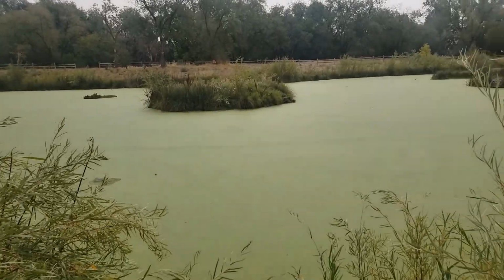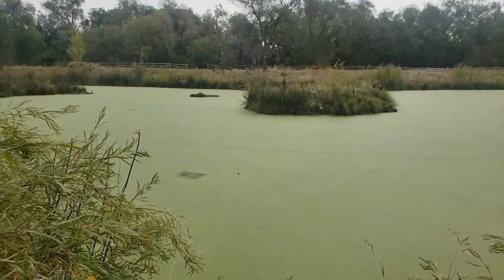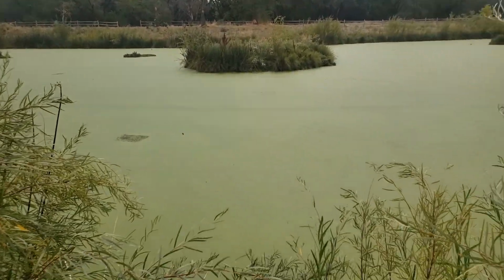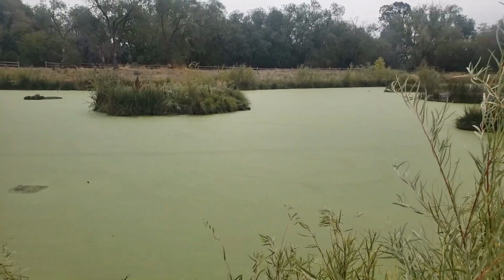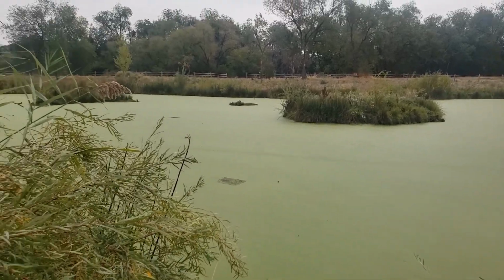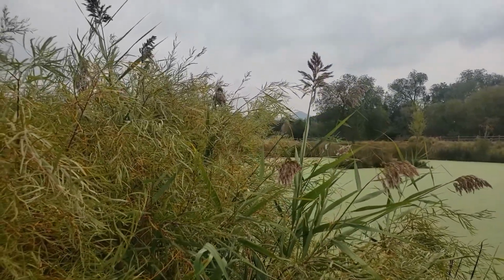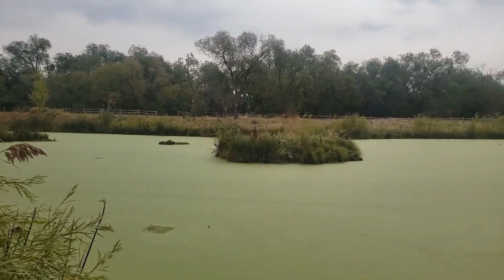Well, if you want your stream to be healthy, or your wetland to be healthy, you're going to want to know that there's enough oxygen for animals to live. You're going to want to know if there's too much nitrogen, and so then there's algae blooms, which end up causing dead zones, because the algae, when it decomposes, takes up a lot of oxygen, meaning that other things can't live. So we're going to learn about this and so much more, but let's dive into the actual tools that we use to measure, and we'll do a water quality sampling together.